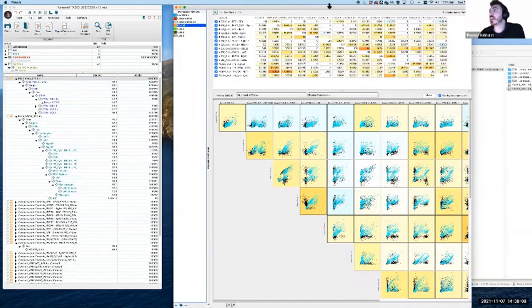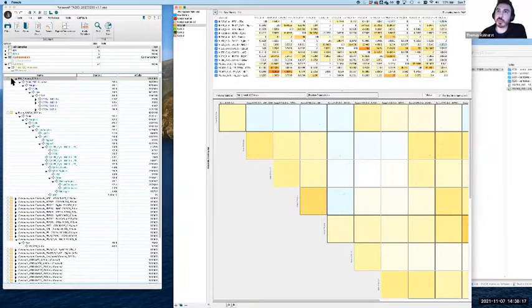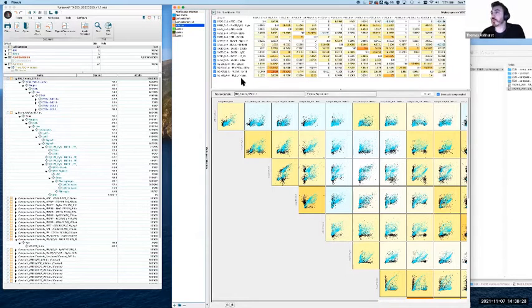and then we'll mess with things. All right, so if you're using FlowJo, the way that you can access the compensation matrix is by clicking on this little rectangular grid here, which will be either gray if it's the default applied on a cytometer, or it'll be colored if you've made one on your own. Now, the way to read this, and hopefully the resolution is okay here for everybody, but essentially the layout's always the same. So in this case, each row represents a fluorophore detector pair, and then the column represents the same. And so the way that I like to read this is the row is the contributor. So the row is the fluorophore, and the column is the receiving detector.